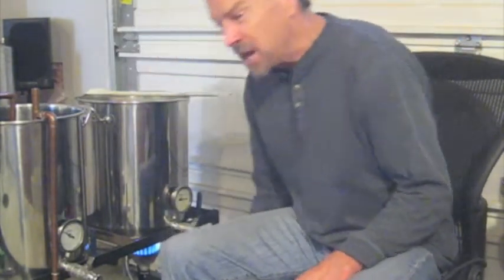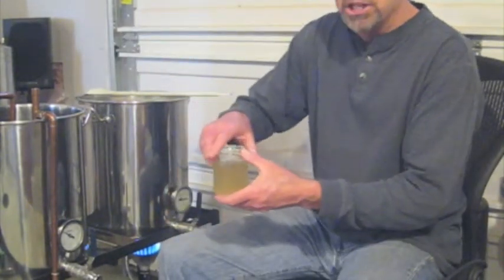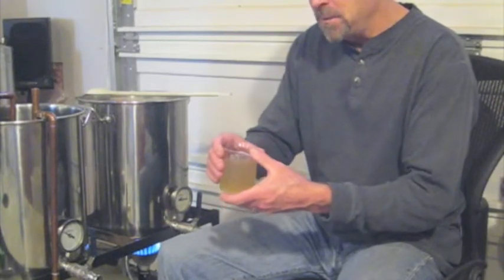This is a partial mash that I'm doing. There's going to be a video on that too you might want to check out. But it's nice because it gives me multiple points at which I can take samples to make our comparisons.